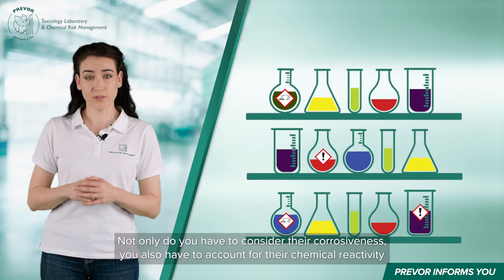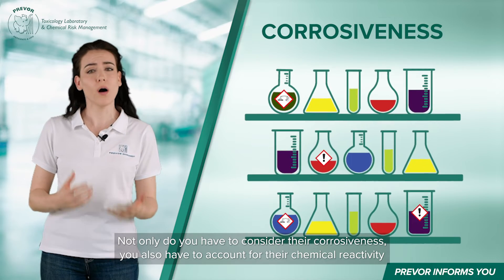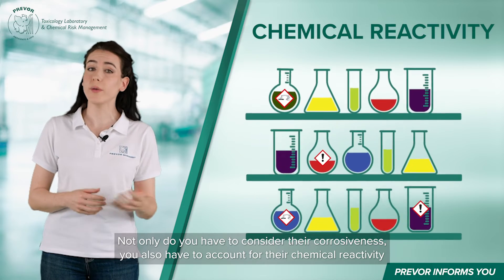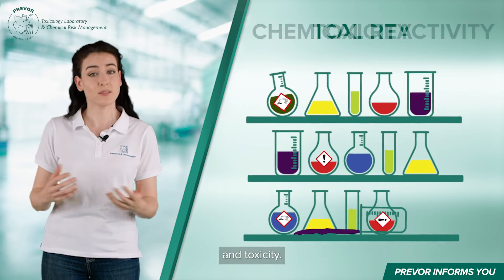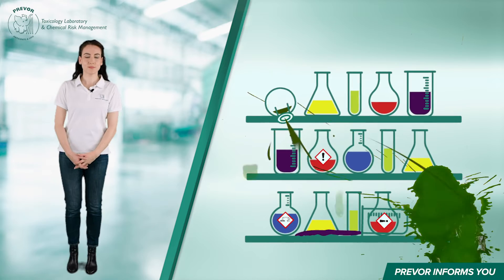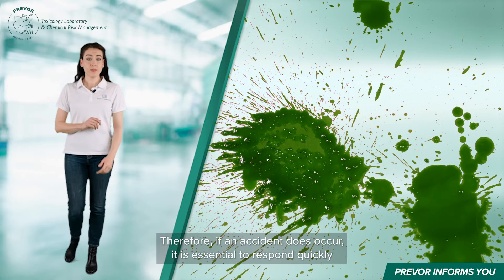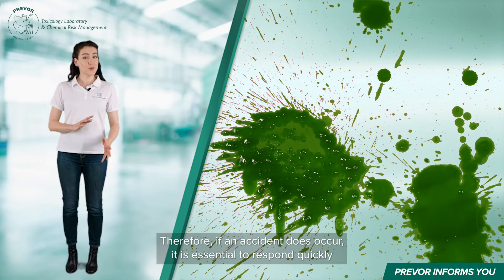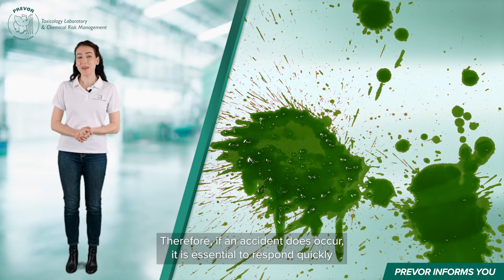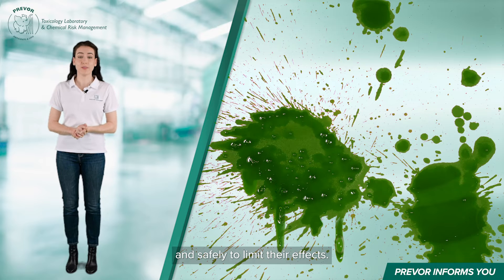Not only do you have to consider their corrosiveness, you also have to account for their chemical reactivity and toxicity. Therefore, if an accident does occur, it is essential to respond quickly and safely to limit their effects.